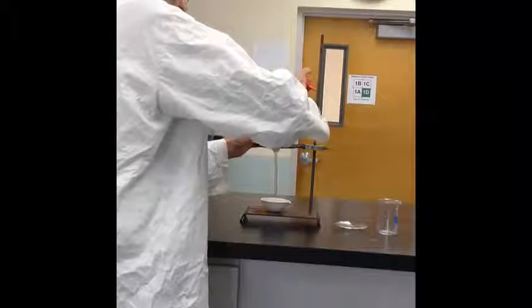At this point, we're ready to begin using the differences in solubility to wash down the salt out of the mixture. We'll do this with 4 portions of 5 milliliters each of hot water. And so you can obtain hot water, and we'll pour the first one in over the top of the salt sand mixture.